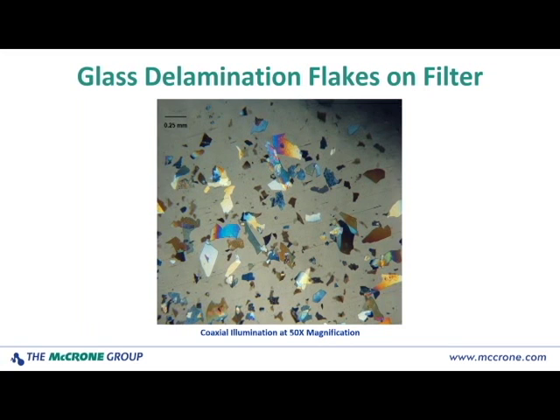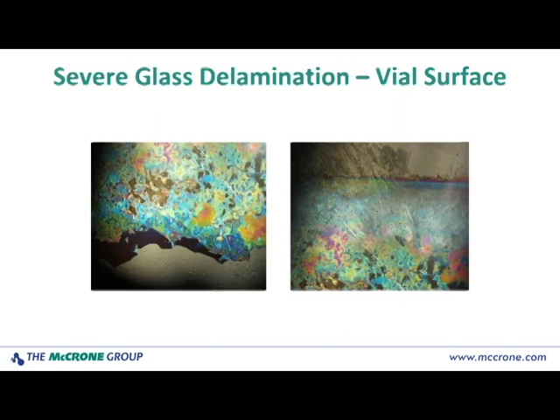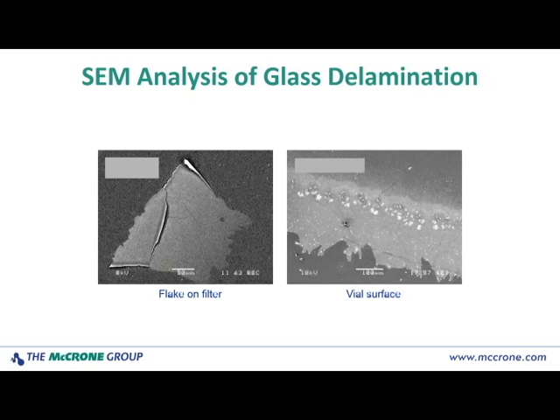So this is very recognizable by polarized light microscopy. These are images of the interior of a glass vial after it's been broken, as I've described. You also see the thin film interference colors indicating different thicknesses, and you can see that there's a lot of porosity and degradation of the surface of the vial. So this is very severe and advanced delamination, again readily recognizable by PLM.